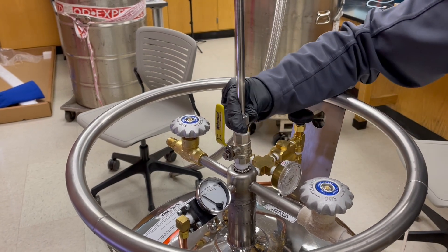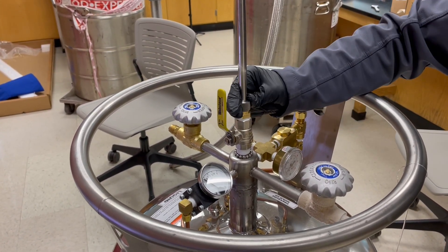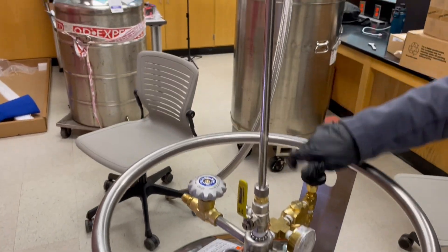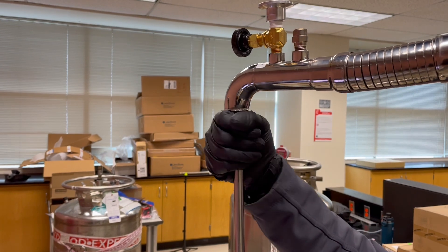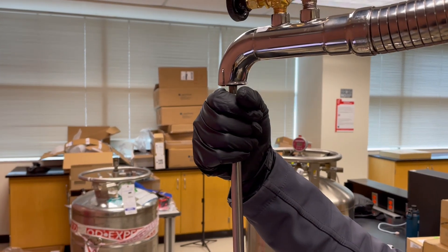Use your hand. Make it tight. And it should transfer to here, right? And I might need to fill up some pressure later. But now it is closed. So I need to turn this like anti-clockwise.